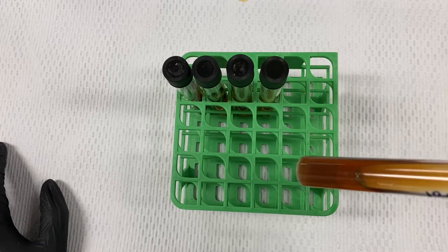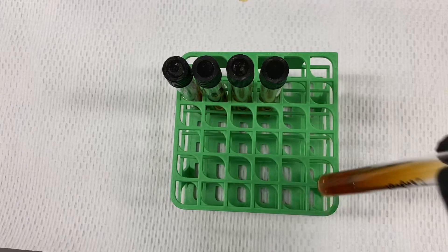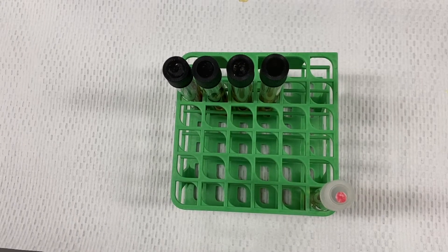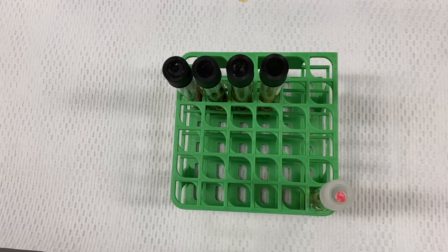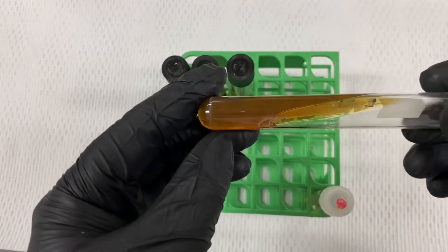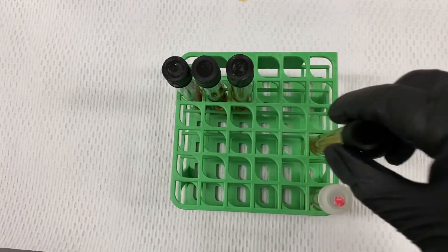As it exits, we usually will coat the slant itself. After in this case 24 to up to 96 hours, we will look at the presence of color changes and the presence for gas.